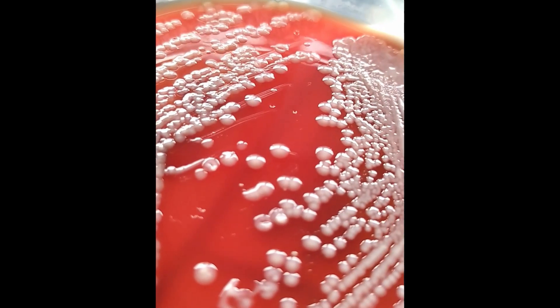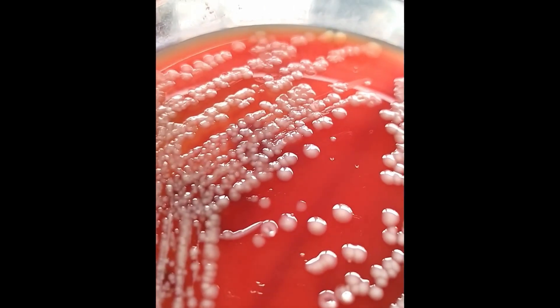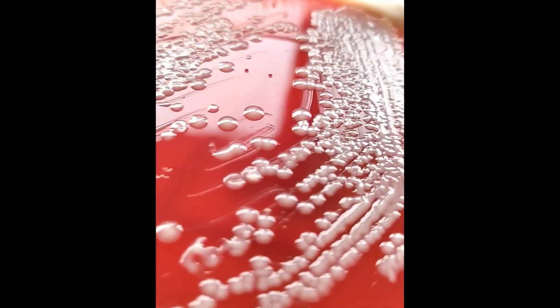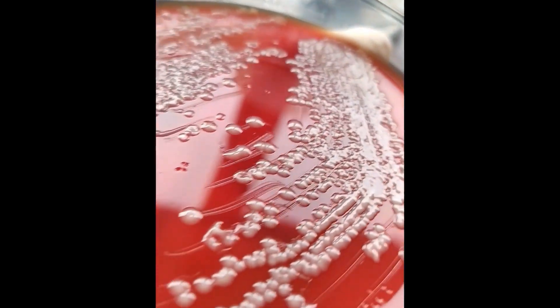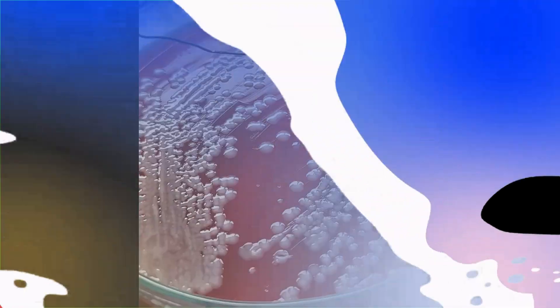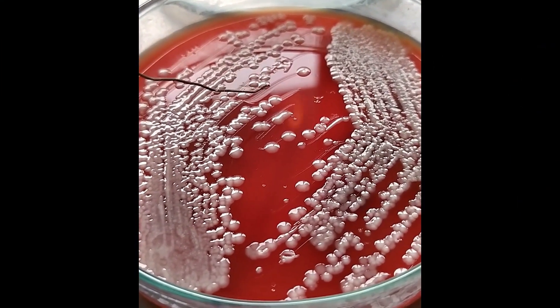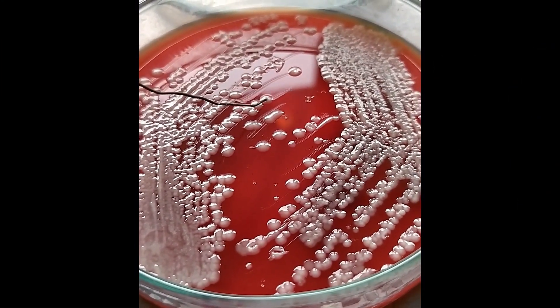The presence of a capsule gives the colonies their glistening appearance. Now you know Klebsiella pneumoniae colonies are mucoid — in this video you can see this characteristic demonstrated.